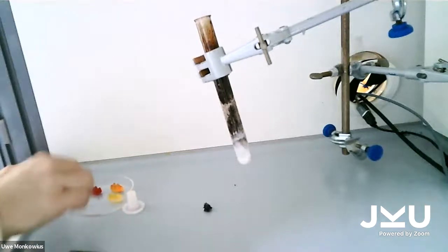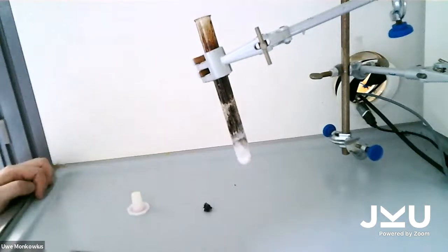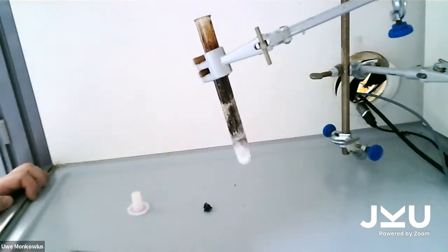The gummy bears are struggling today. Don't want them to suffer any longer. So I will clean up this mess again, and then I'll see you with the last way of how to torture some gummy bears.